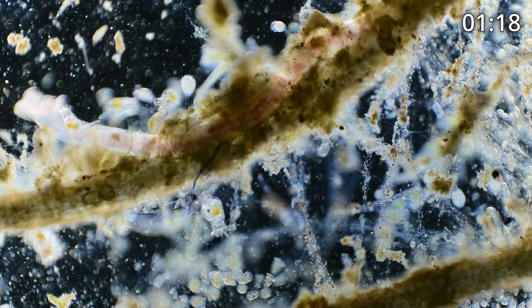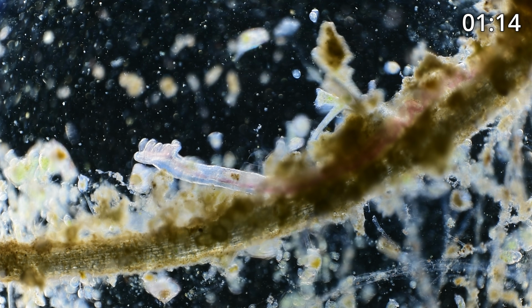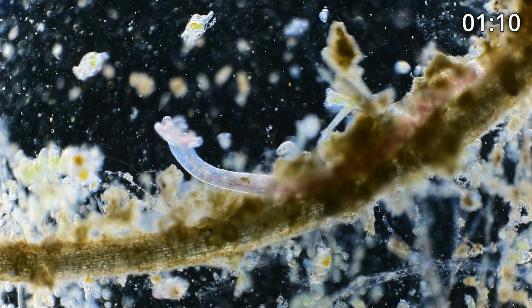So these single-cell peritrichs, the reason there are so many is because they're in a nutrient-rich environment at the fishing pond. And at that fishing pond, they're undergoing binary fission regularly over and over again. And they just keep going and going and going. And 1 turns to 2, turns to 4, turns to 8.